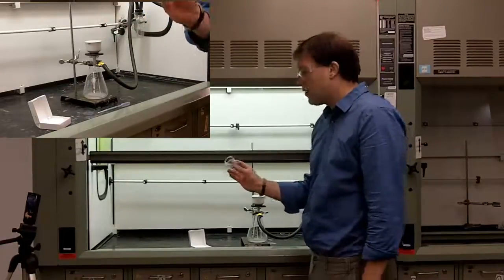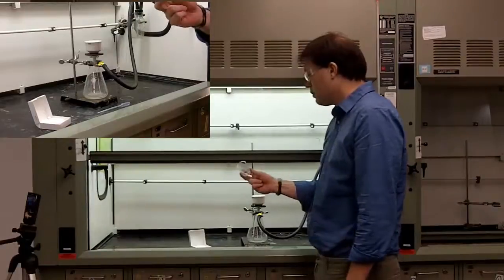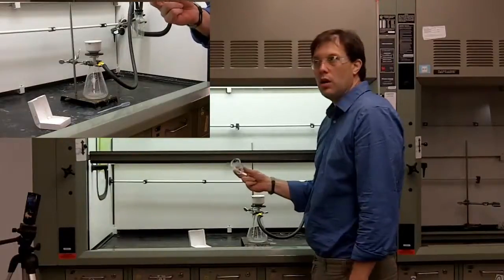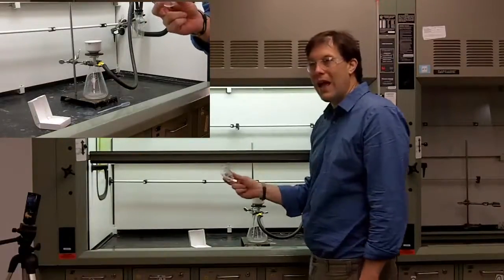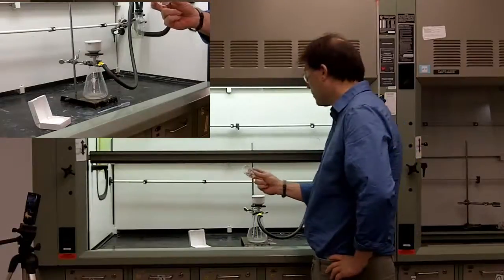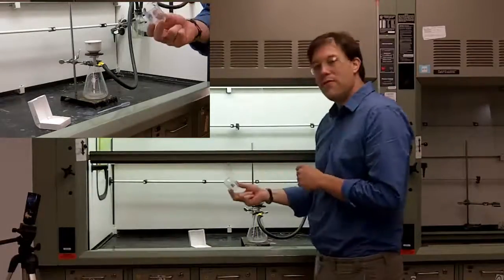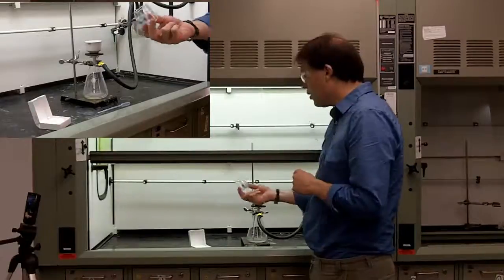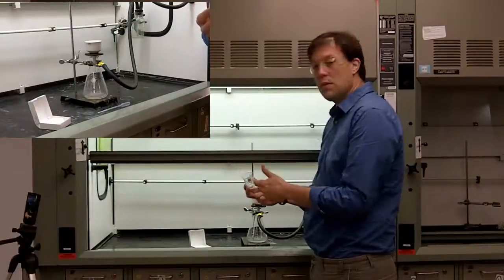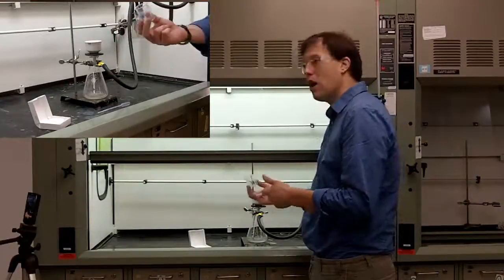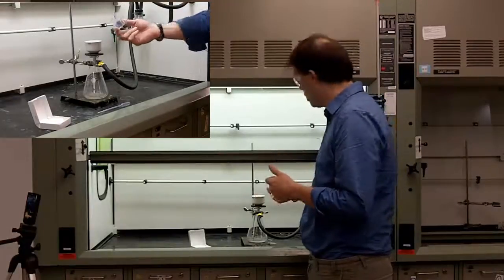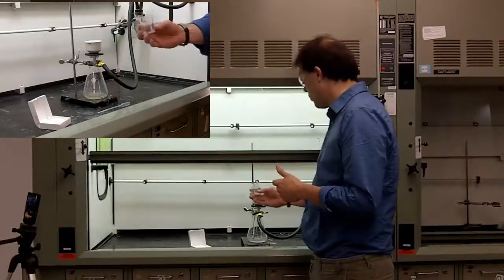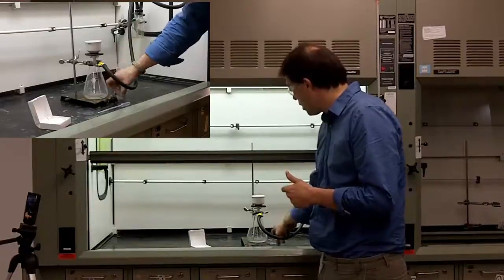Now, if you have sample left in your beaker here after pouring it over, what you can do is use some of your solvent, whatever it was that you just poured off, to kind of wash it over with the rest of it. But for now, I won't worry about that.